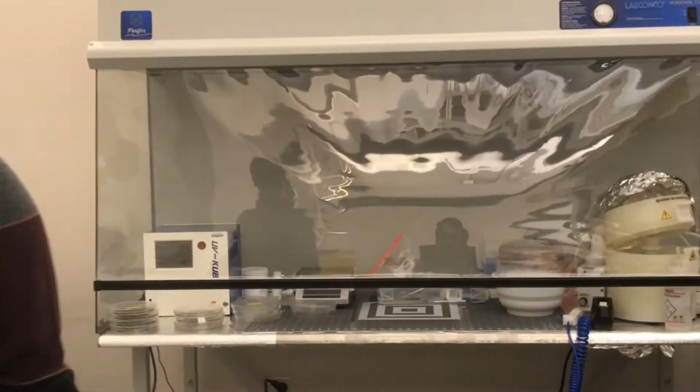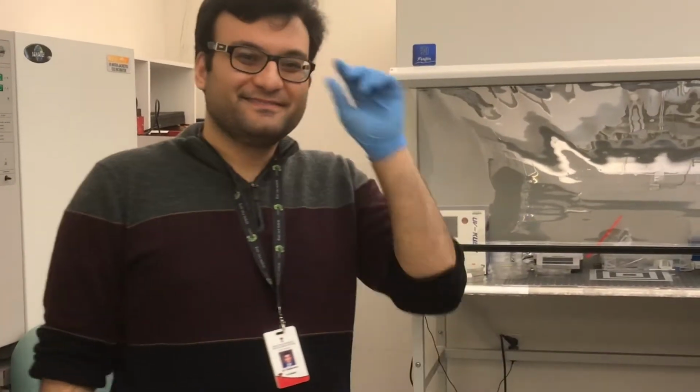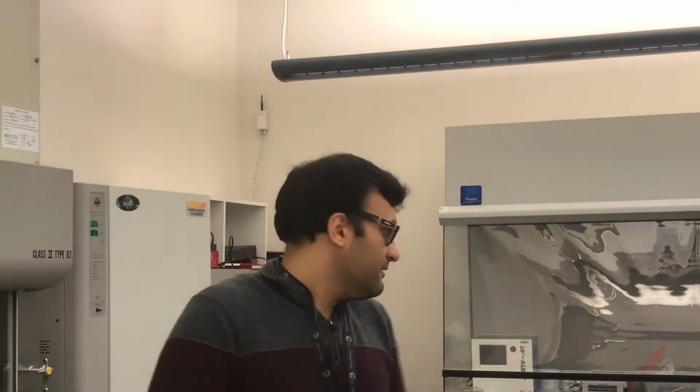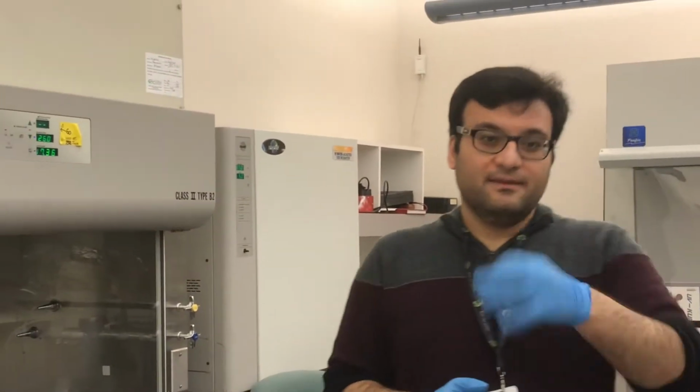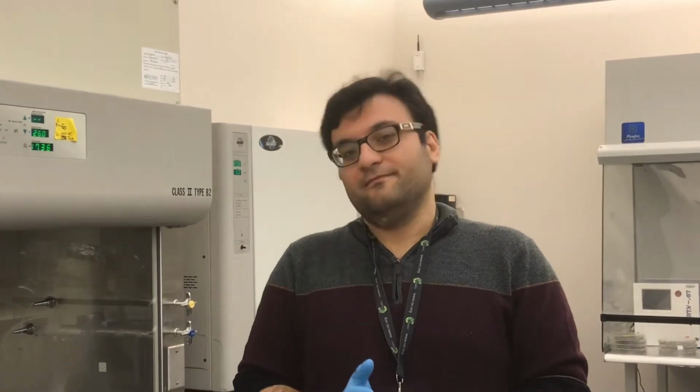Can you explain why? If it is hot and you start cutting, the master mold will break. So that means this is one kind of curing too? No, this is just because we don't want the master mold to break. So for this reason, the master mold needs to be completely cold. In reality the chip is ready, but if you try to cut, the master mold will break because of the temperature.